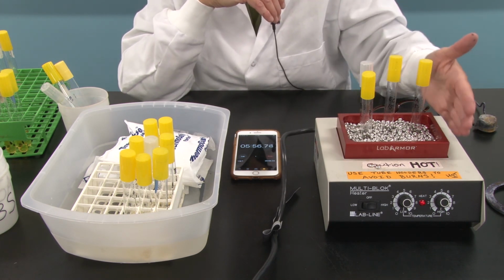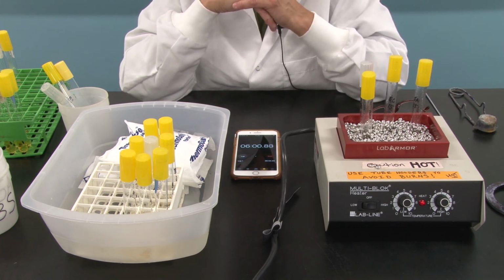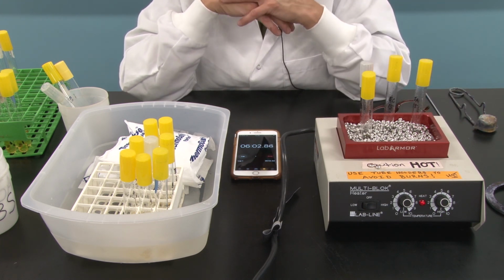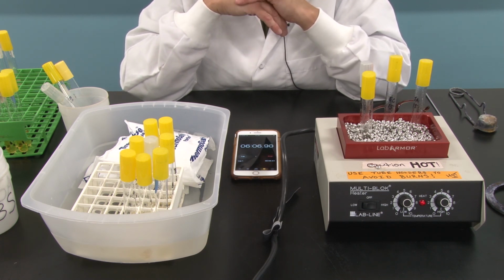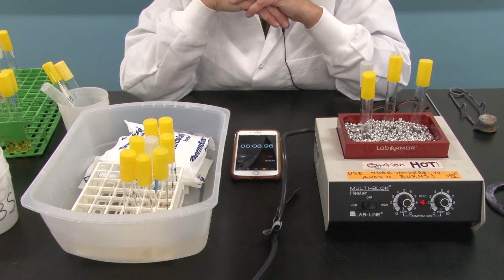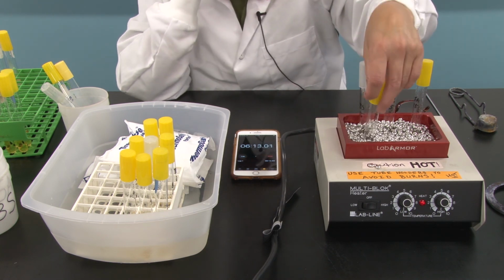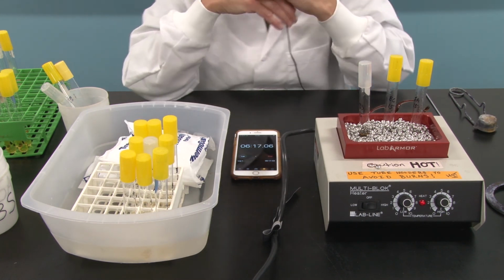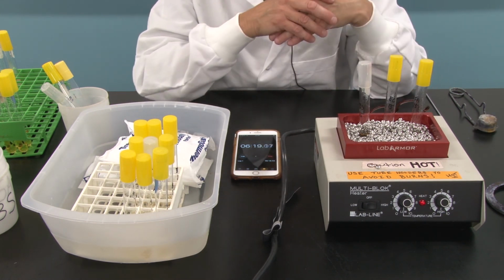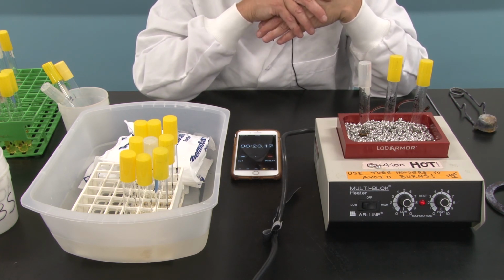Remember, this entire heating block is extremely hot. Recall that aluminum has a very low heat capacity, which means it heats up very rapidly, and it cools off very rapidly too. But those beads right now will burn you if you touch them. Okay, so I'm going to go ahead and take the Bacillus out as well. And now what's left are the 15-minute tubes. So we're going to cut the video and come back when 15 minutes is up, and we'll remove those test tubes at that time.